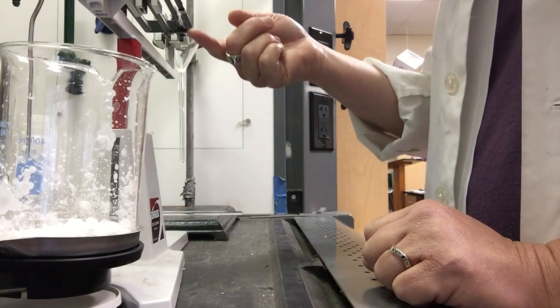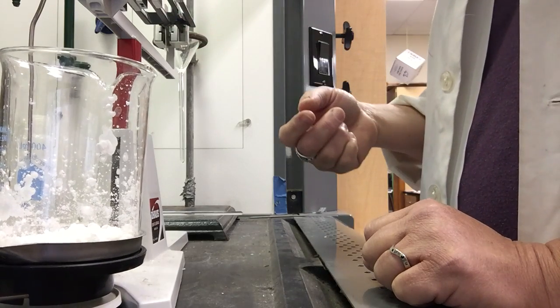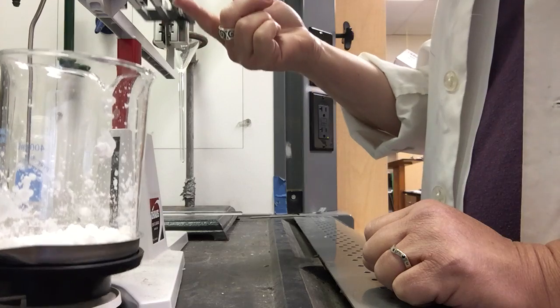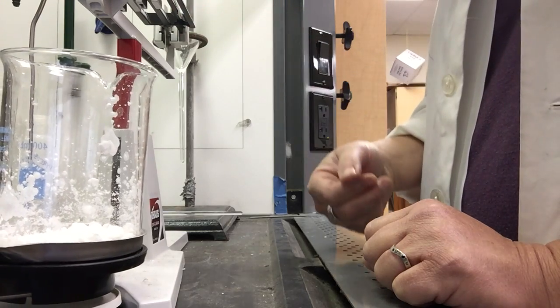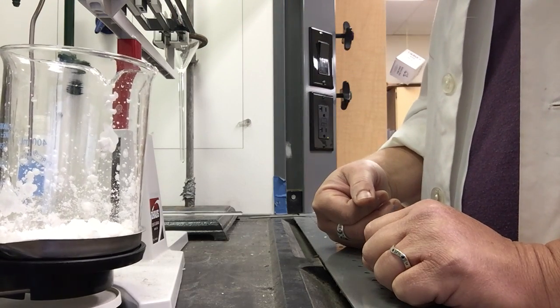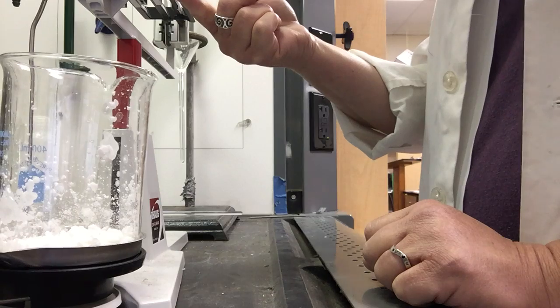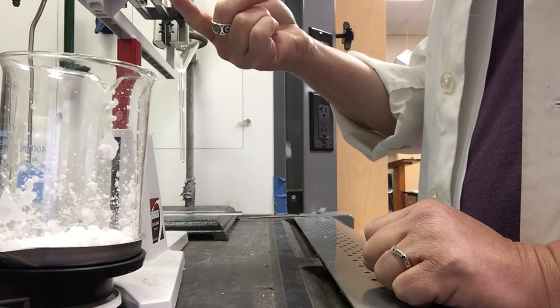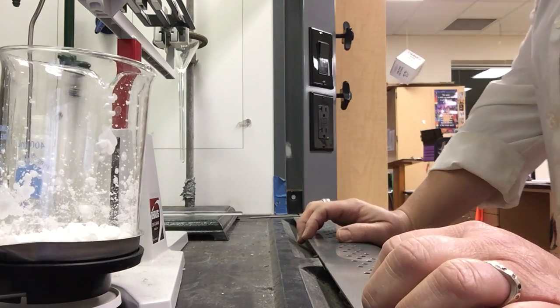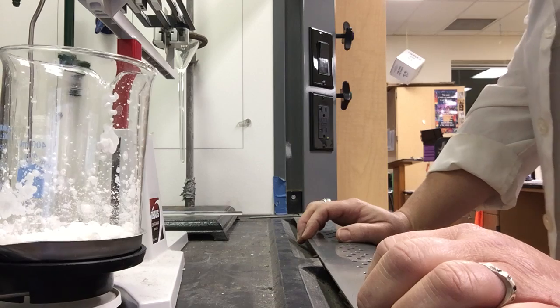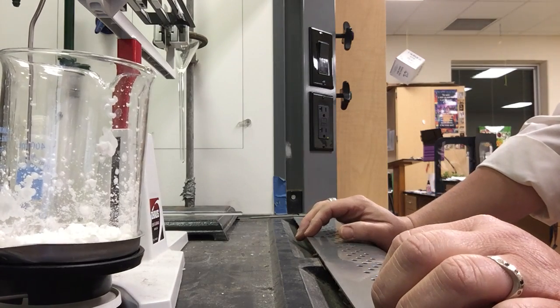It's too heavy at 0.6. Still too heavy at 0.5. Still too heavy at 0.4. Let's take it down to 0.2 and see what we get. At 0.2 I'm getting pretty close to balancing.